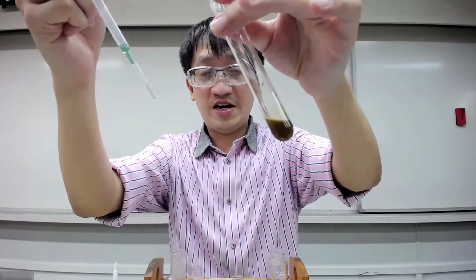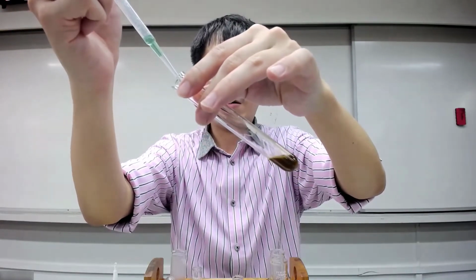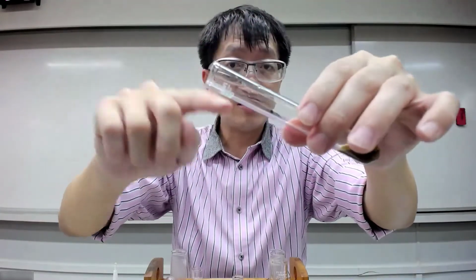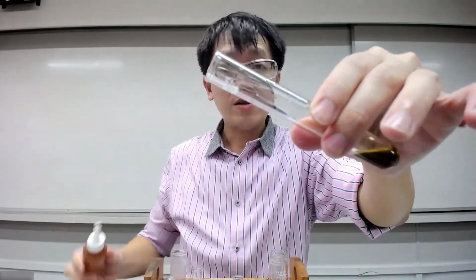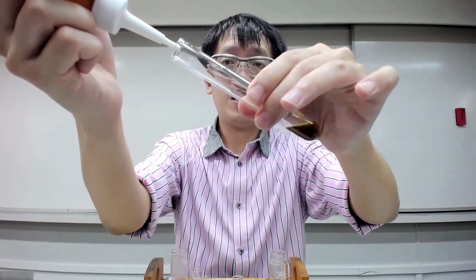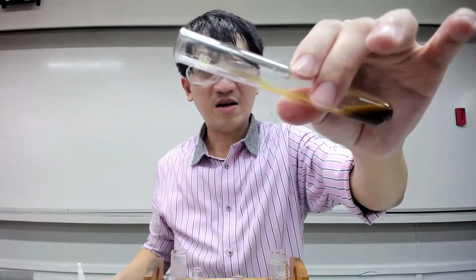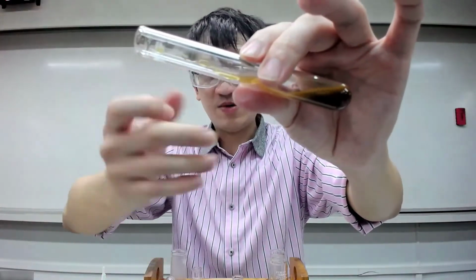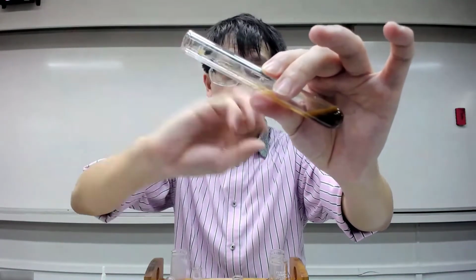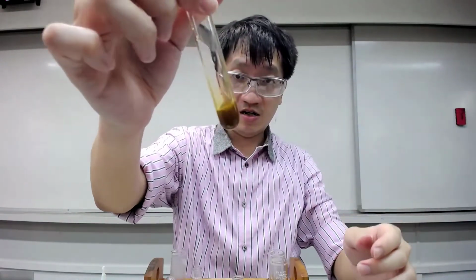Take some more Fa1. I just drip 1 drop at the side. You let it flow in. You can see that the 1 drop is here, right? So I'm going to add this to the same 1 drop. Slowly up. Can you see the trail left here? It's a bit of white, powdery PPT, and then there's a bit of brownish solution. Can you see that?